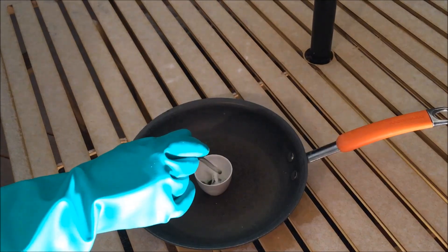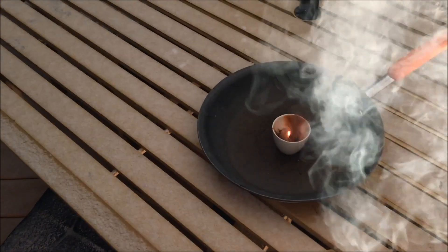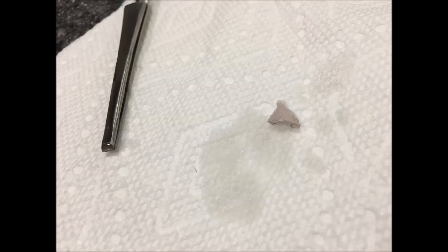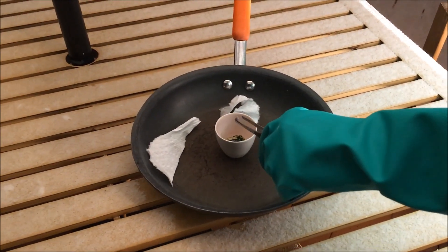This was a cotton ball. I then decided to cut off a small piece of sodium from my sodium collection and throw it into the manganese heptoxide to see what it would do.